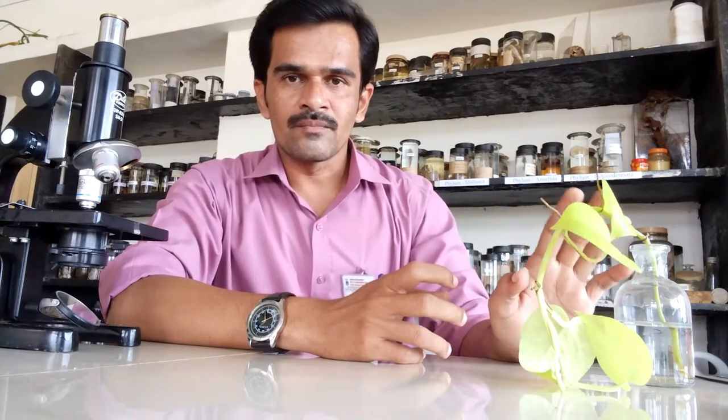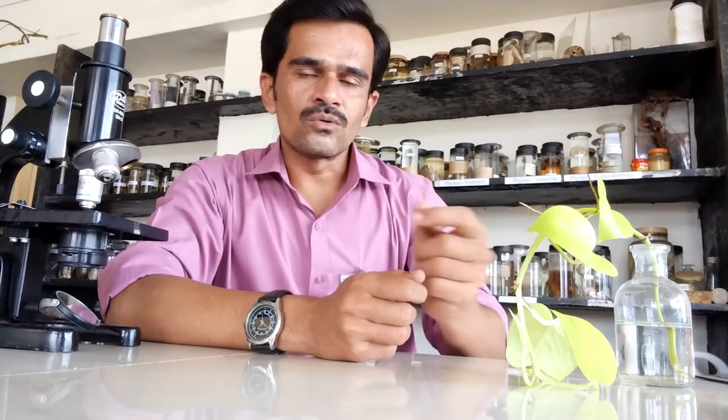In this practical, we are going to make a slide of a plant material — specifically, how to visualize the tissue inside the plant stem by making a slide.